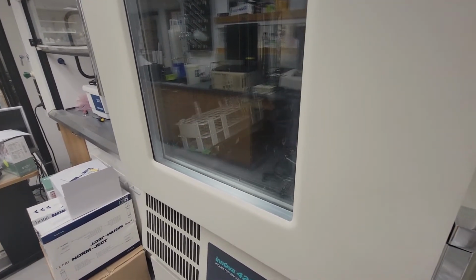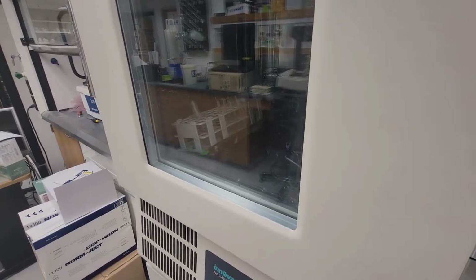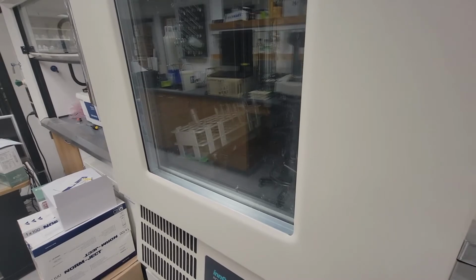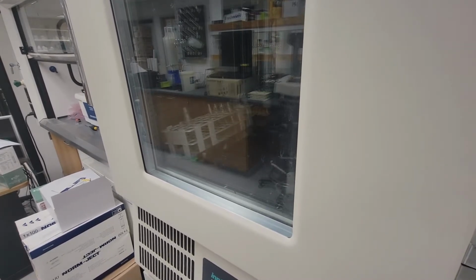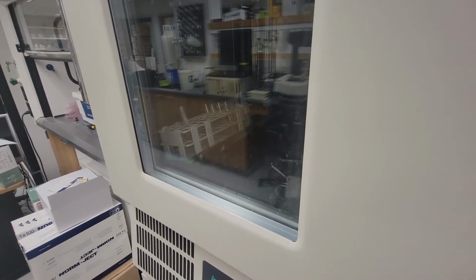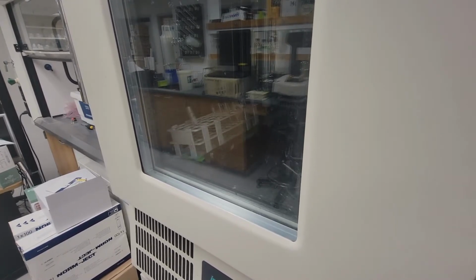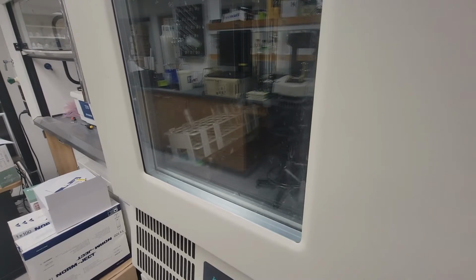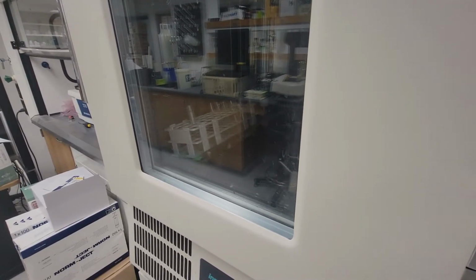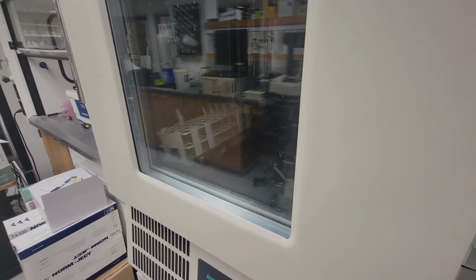Then check the optical density as shown before using the spectrophotometer. Make sure to note the optical density and minutes that have passed when checking. It should be 60 minutes. After the initial 1 hour optical density check, make sure to check the OD every 30 minutes until the OD levels out. Again, make sure to note the OD and minutes that have passed each time you check.